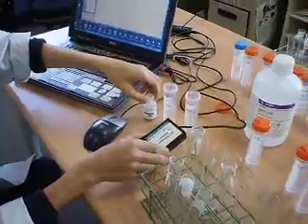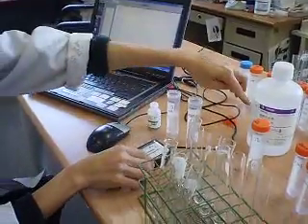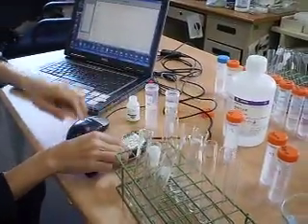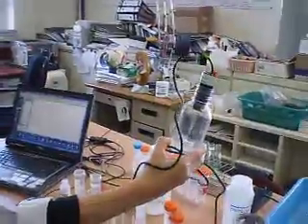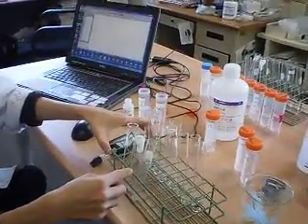We're going to measure the rate of reaction, or the pressure change, using a gas pressure sensor, because hydrogen peroxide decomposition will release oxygen gas. There are two ways to measure it, using a gas pressure sensor or an oxygen sensor, which is this oxygen sensor down here. For this reaction, I'm going to demonstrate using a gas pressure sensor. I'm going to use a test tube.